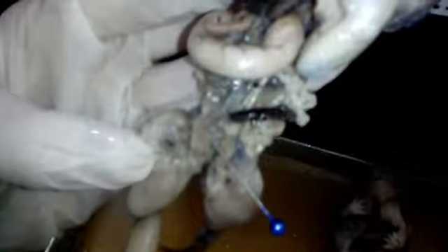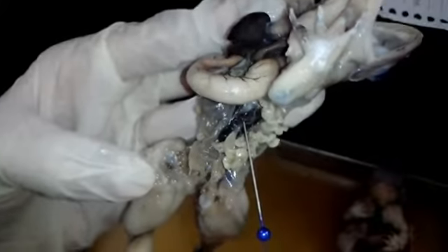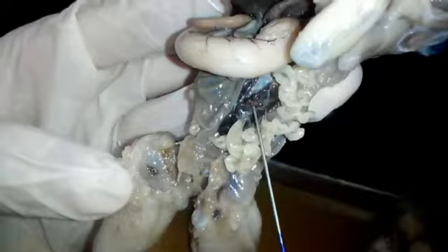This is the urinary bladder, which serves as temporary storage for urine. This is the kidney. It removes waste products from the blood and makes urine.